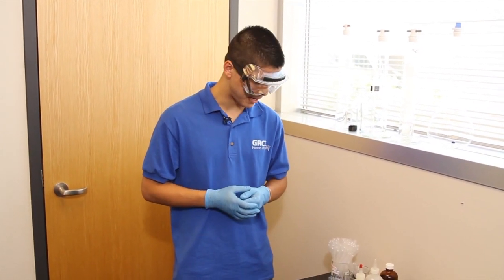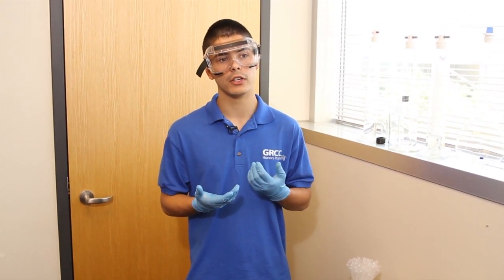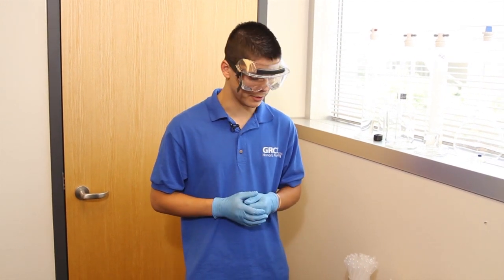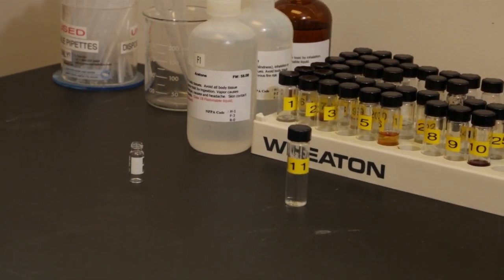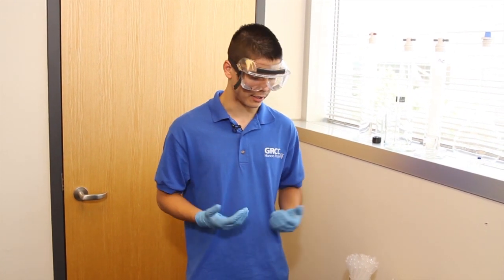There are some benefits to using a small sample amount. First, if you don't have a lot of sample — in organic chemistry, your yield might only be about 10% — you can still analyze your compound even with that little bit of sample. Second, you don't need to exhaust your sample just to analyze it. Because I only need a little bit, I can aliquot some of it to run on the instrument and save the rest to do other experiments and tests with.